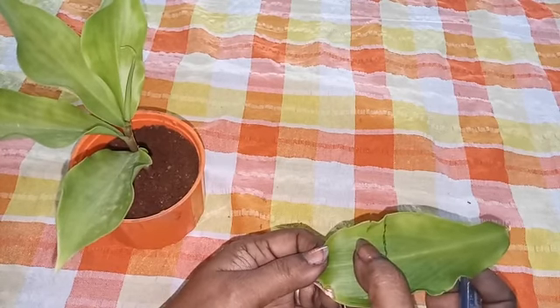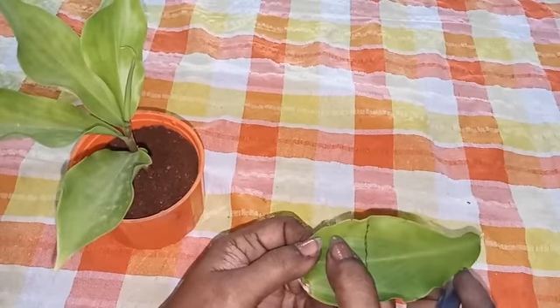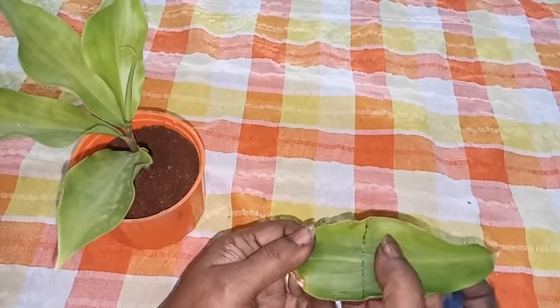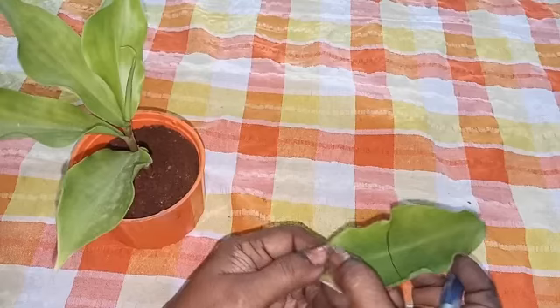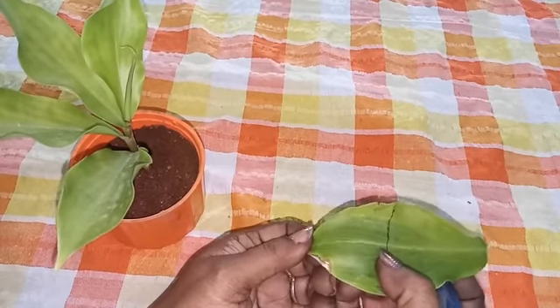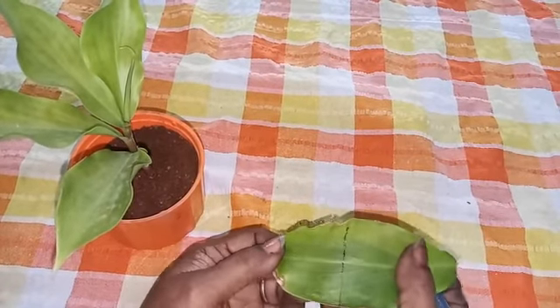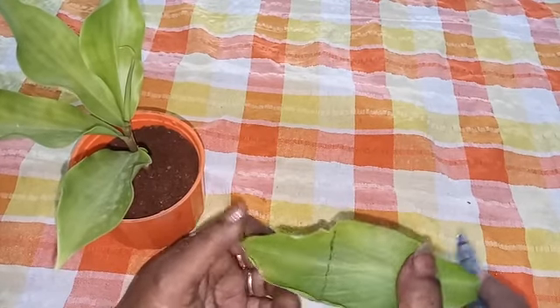Why is it not getting carbon dioxide? We have kept potassium hydroxide in the wide mouth bottle, and that potassium hydroxide will absorb all the carbon dioxide present inside the bottle. So there will not be any carbon dioxide inside the bottle. So this part of the leaf is not getting carbon dioxide, so it cannot prepare starch. That's why it is not turning blue-black color. Okay. So with this we are proving that carbon dioxide is necessary for photosynthesis.